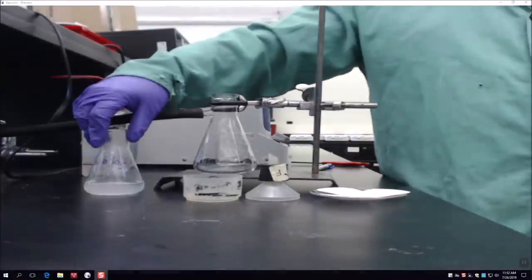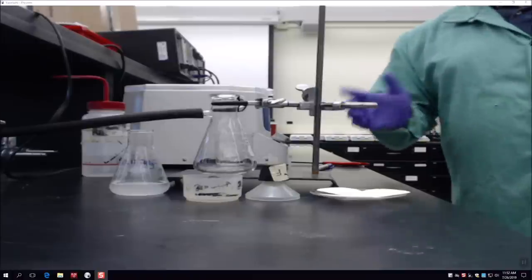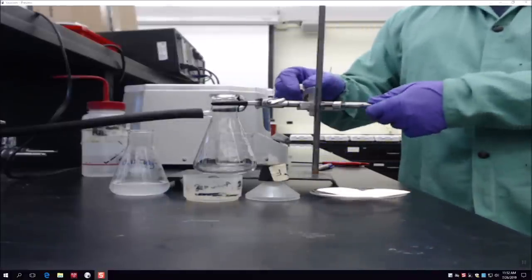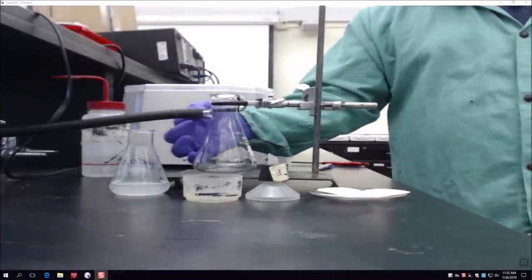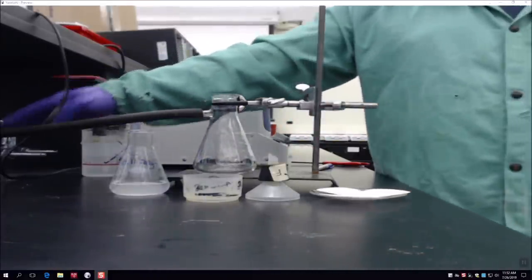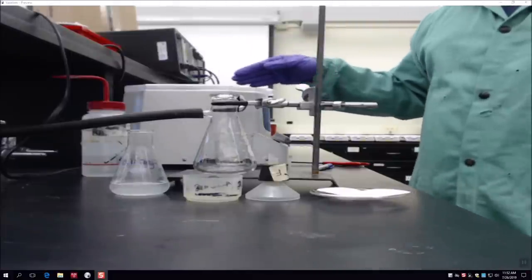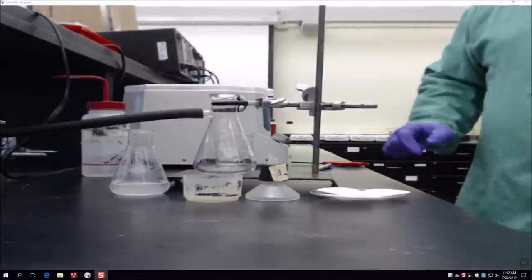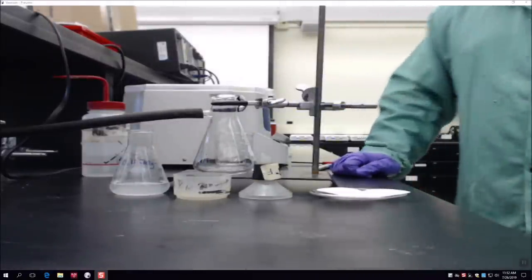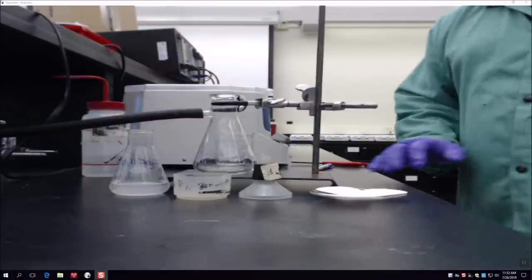Once you've formed your precipitate, you need to collect it, rinse it, dry it, and measure the final mass. You'll need a filtration apparatus: a ring stand, a three-prong clamp, a 250 mL filtration Erlenmeyer flask with a glass side arm, thick rubber vacuum tubing hooked to a VAC nozzle under the hood, a Buchner funnel with rubber stopper, filter paper, and a watch glass. The first thing to do is measure the mass of your filter paper, since the product will be on it and you'll subtract the filter paper mass to get the product mass.